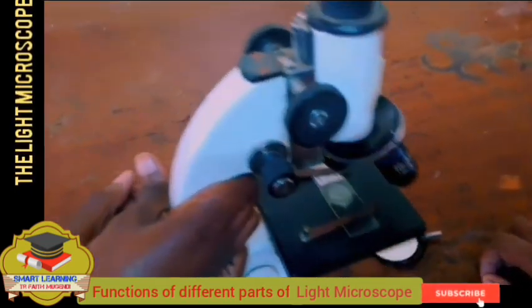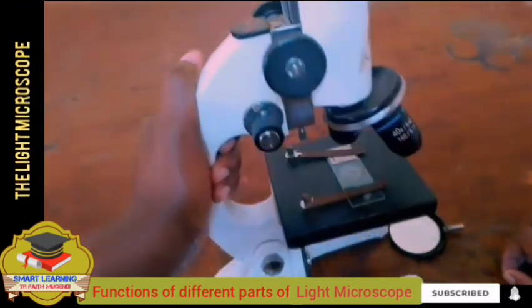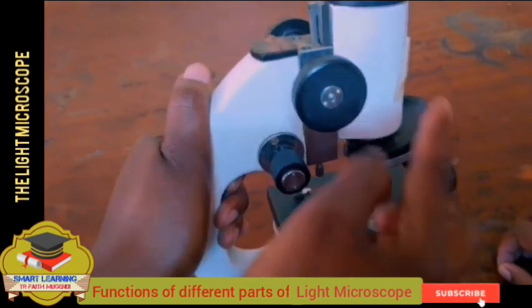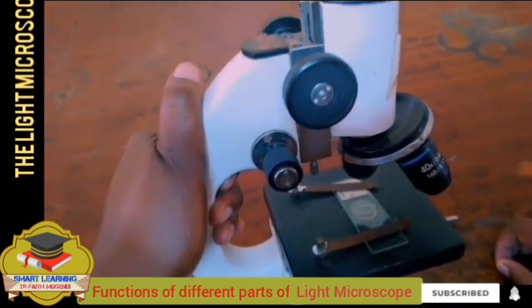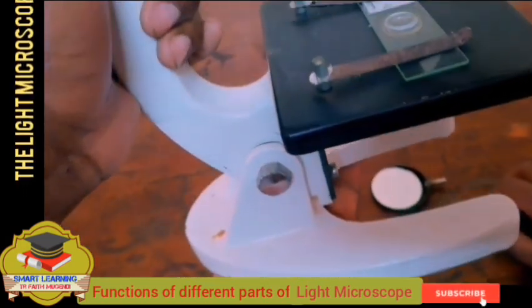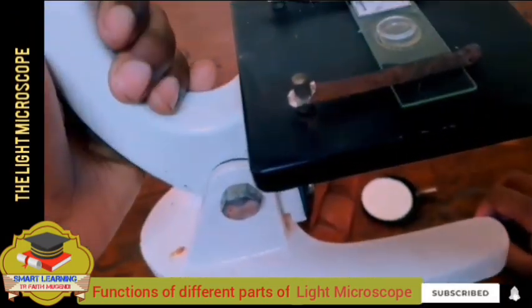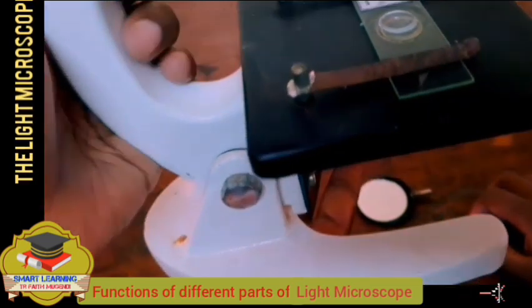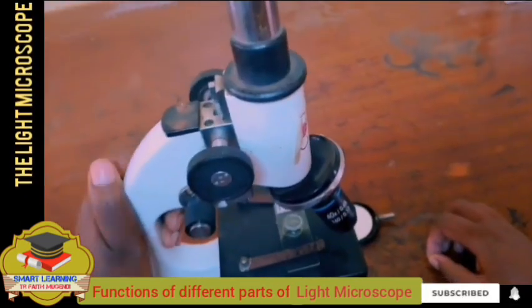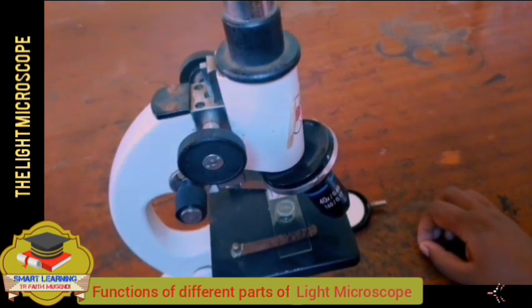This is what we use to carry the microscope. When you look at the arm, it is holding the objective and the body tube in place. And finally, the base. The work of the base is to provide support that bears the weight of the whole microscope. So that is what I had prepared in this tutorial.